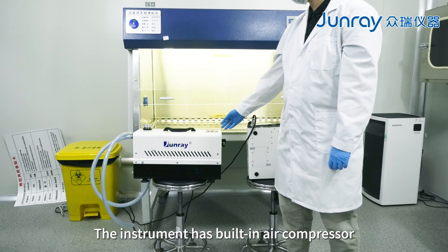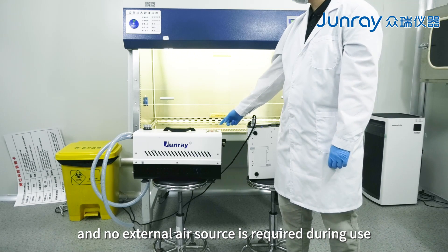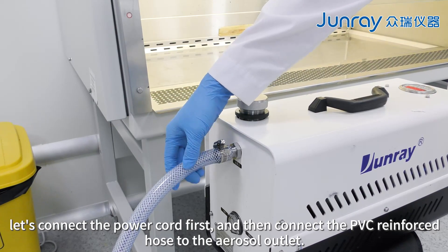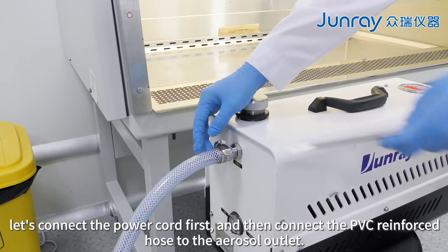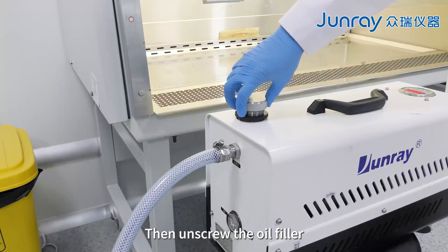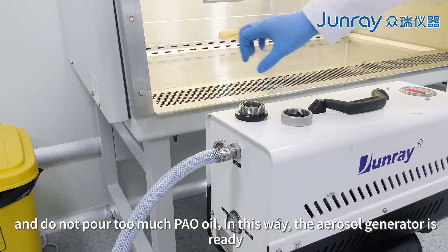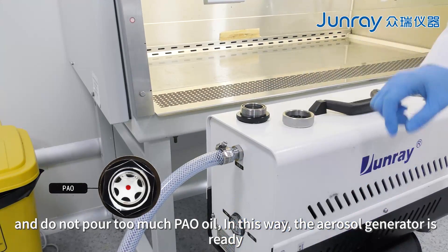The instrument has a built-in air compressor and no external air source is required during use. Just connect the power cord to use. Let's connect the power cord first, then connect the PVC reinforced hose to the aerosol outlet and tighten the hose clamp. Then unscrew the oil filler and pour oil into it. Please observe the oil gauge and do not pour too much. In this way, the aerosol generator is ready.